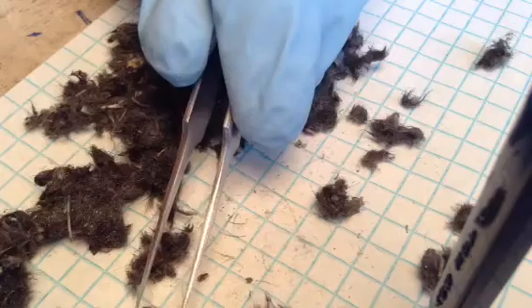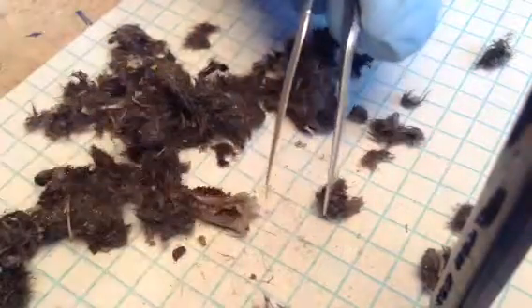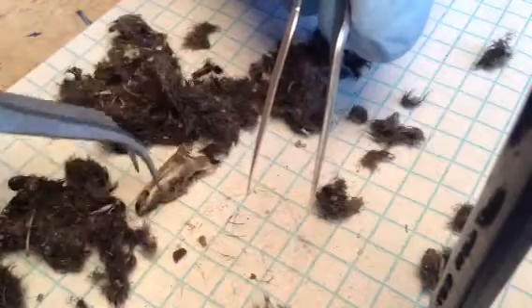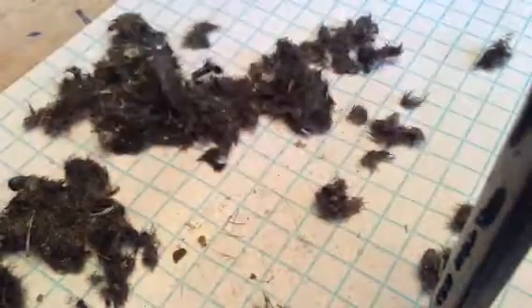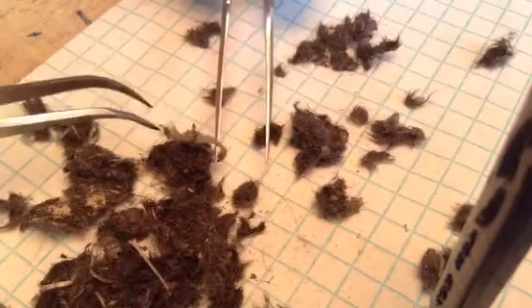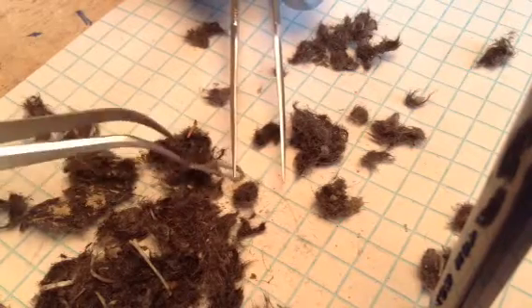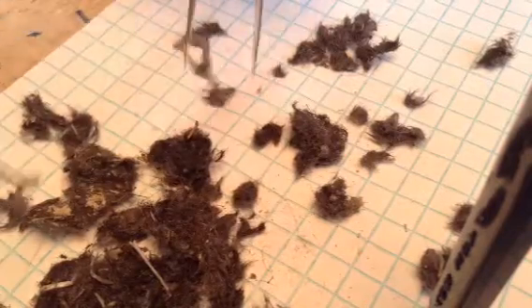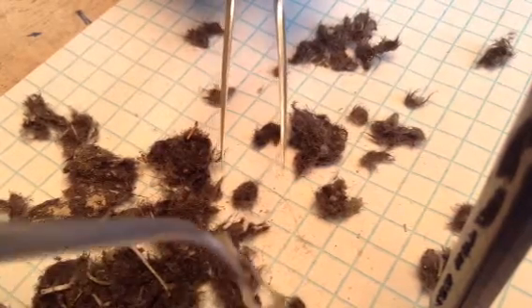Sorry about the poor quality — I apologize, trying to focus it as often as possible. So basically, a little skull there, and a big skull. I'm going to continue on this one. Right here I'm uncovering the hip bone — that I know for sure, I'm almost 98% positive. Nice little hip bone.